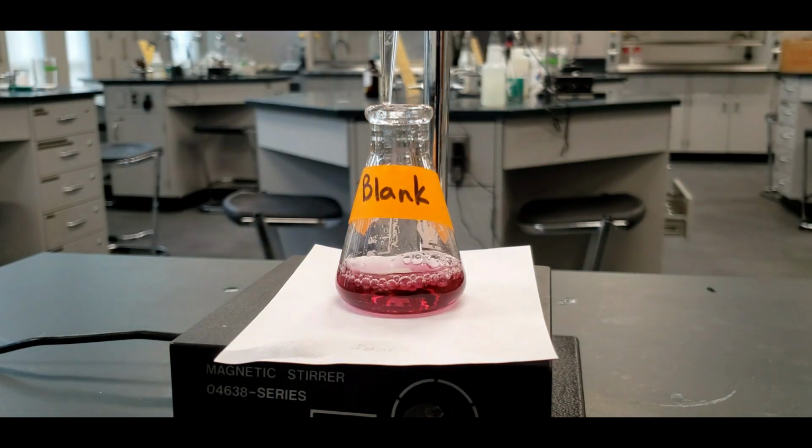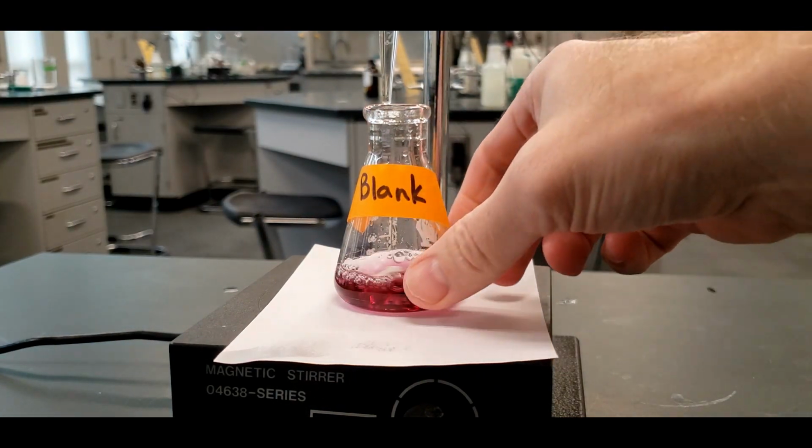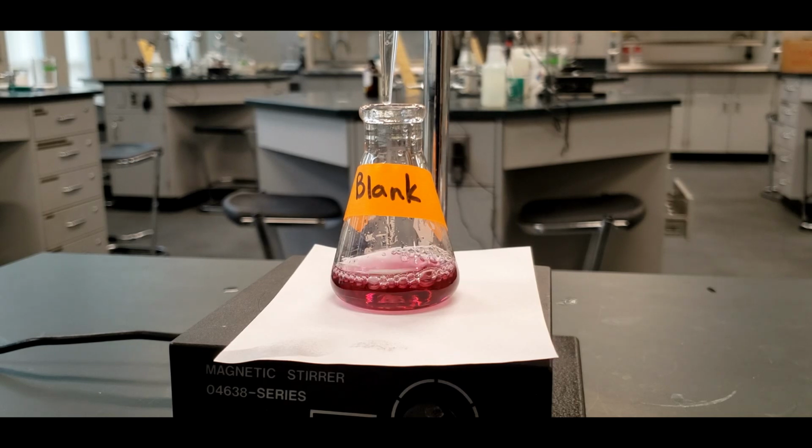That'll help. Okay. So now, unlike with the phenolphthalein that we use for the acid-base reactions, we're not looking for it to go from colorless to a color, or like one of the earlier labs where it went from an orange color to colorless. Here it's just going to change color. It's going to go to a blue or gray look to it. So I'm going to start putting in, and what's in the column is our EDTA. So I'm going to start just doing it drop by drop.